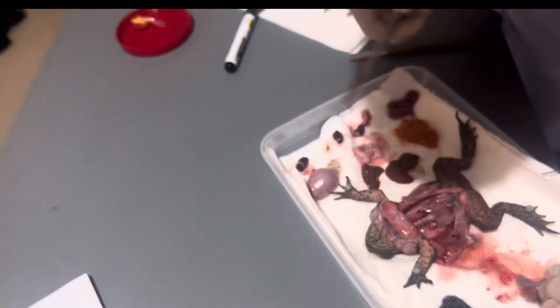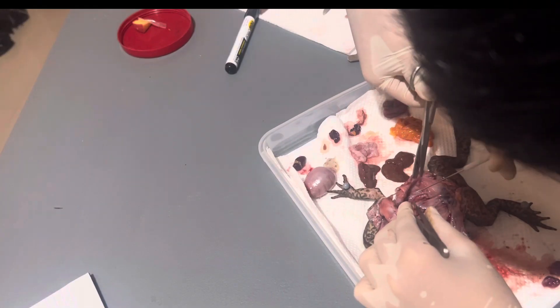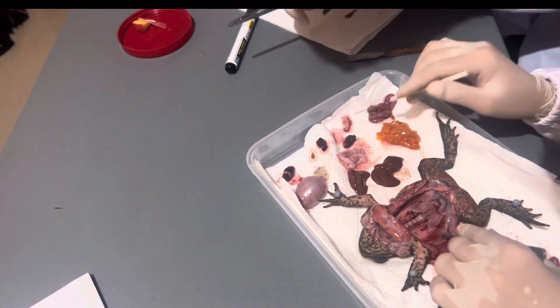And this is the large intestine. The large intestine holds waste and absorbs water. And this is the peritoneum — a spider web membrane that covers many of the organs. It helps in protection and it prevents the body parts from getting damaged.